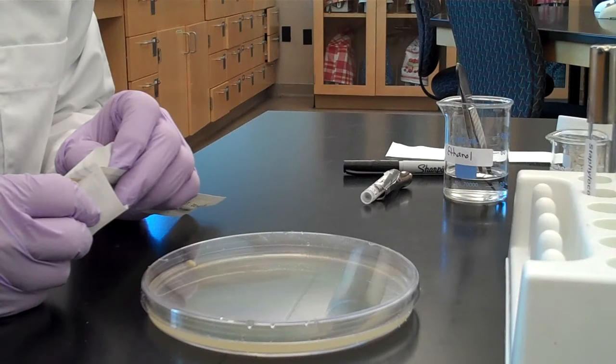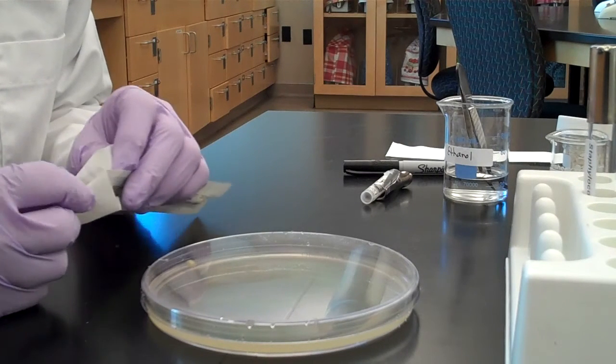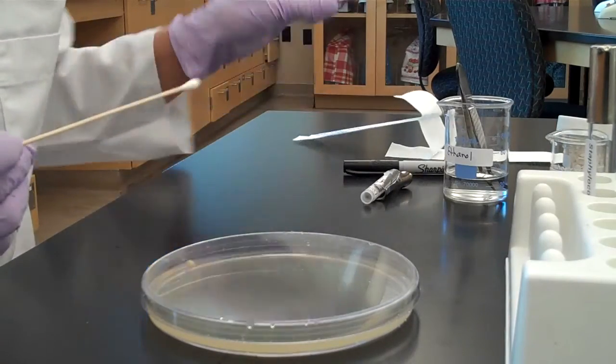Today we're going to demonstrate the antibiotics, disinfectants, and antiseptic lab. The first thing we're going to demonstrate is how to get a confluent growth of your organisms on your plate.